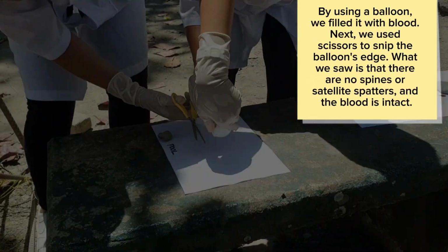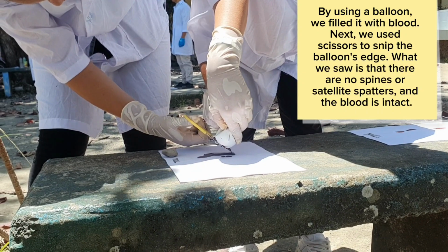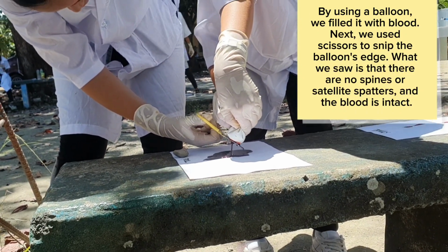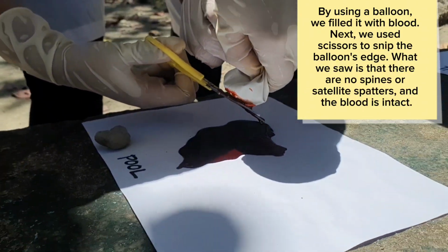Pool. By using a balloon, we filled it with blood. Next, we used scissors to snip the balloon's edge. What we saw is that there are no spines or satellite spatters, and the blood is intact.